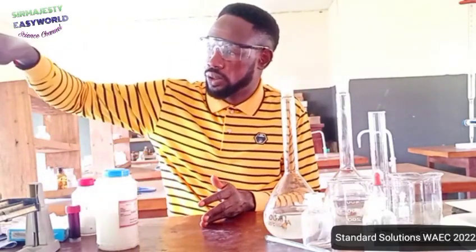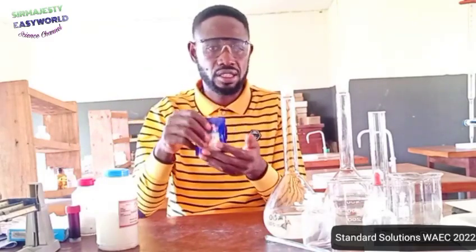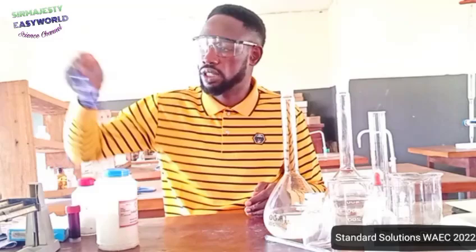Then for the preparation of starch, you need your cold water starch. I advise you use it. This cold water starch is the number one they sell. It also serves the same need.